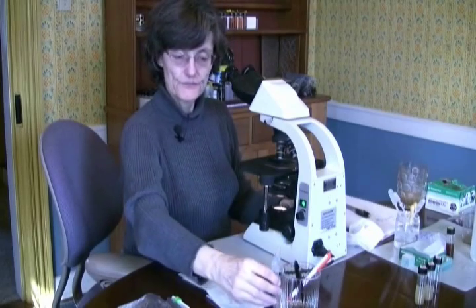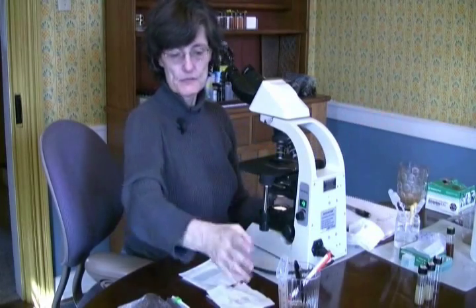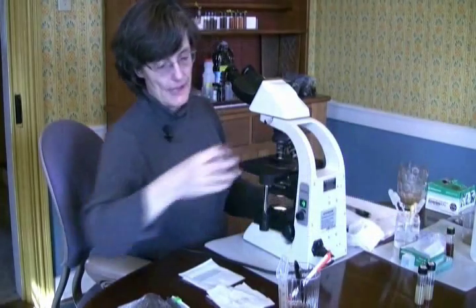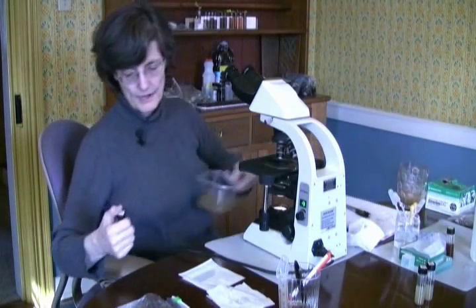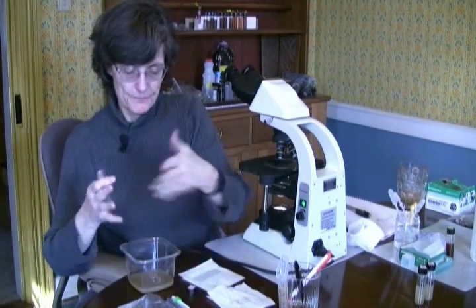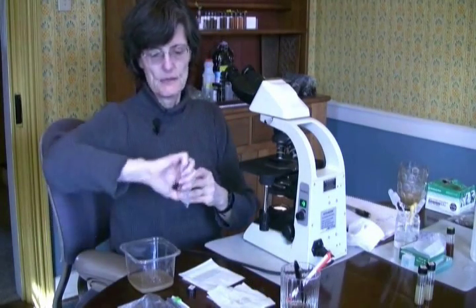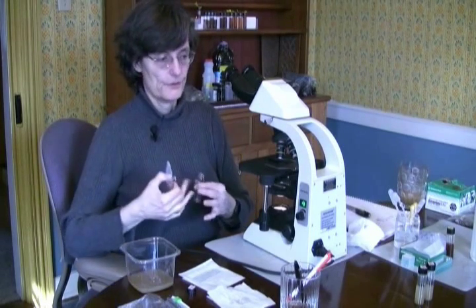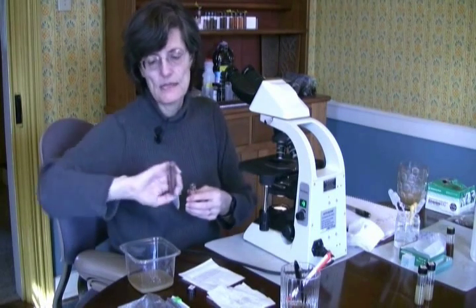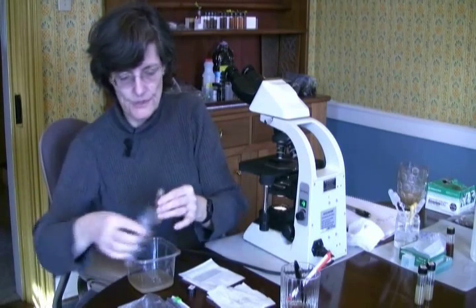I'll typically leave the first sample sitting there. If I'm not going to do any more samples, I'll just leave it sitting in my little measuring cup. If I have other samples to do, I may want to have a waste container — the samples I've done previously this morning go in there. Now I'm going to want to save some of this sample because I want to see if my protozoa or my fungi might start growing. So I'm just going to mix this up and pour some into that container.